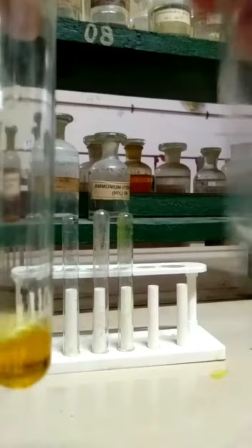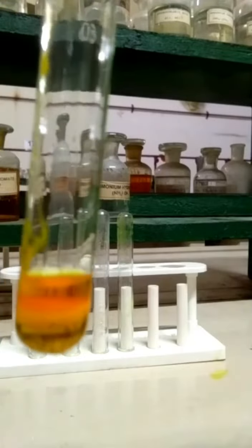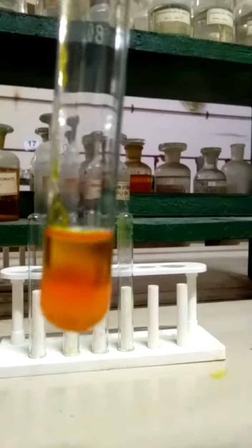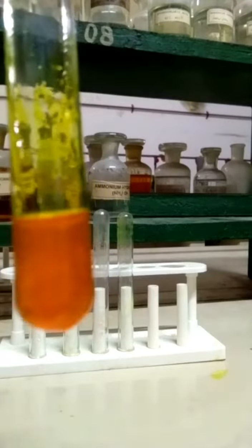Now record the observation. The amount of acetone taken here is in excess. First, the precipitate will be obtained, but after adding excess acetone, the precipitate will dissolve in the excess acetone.